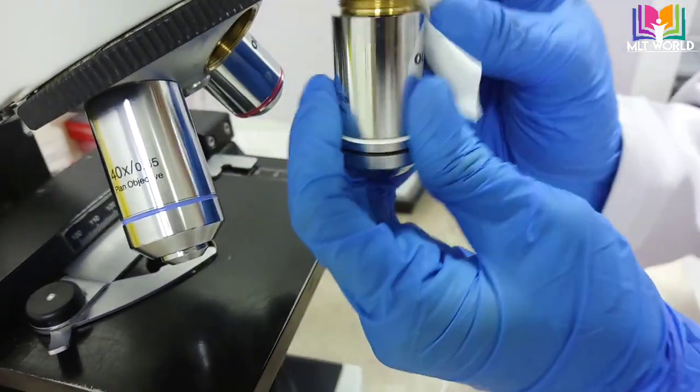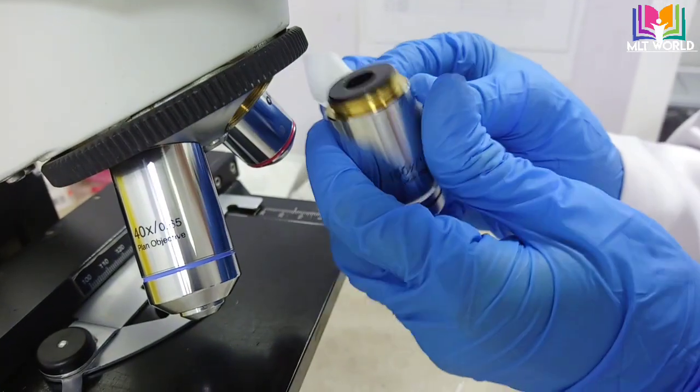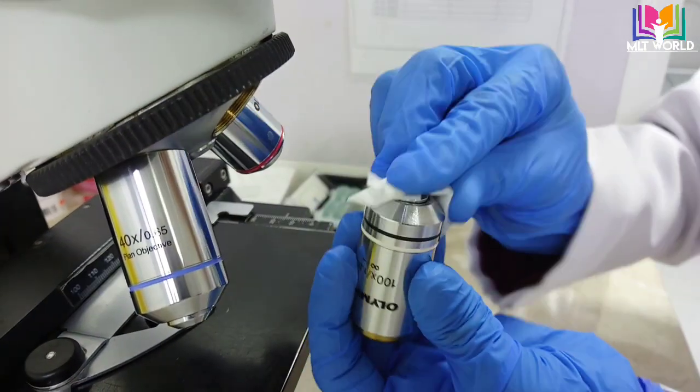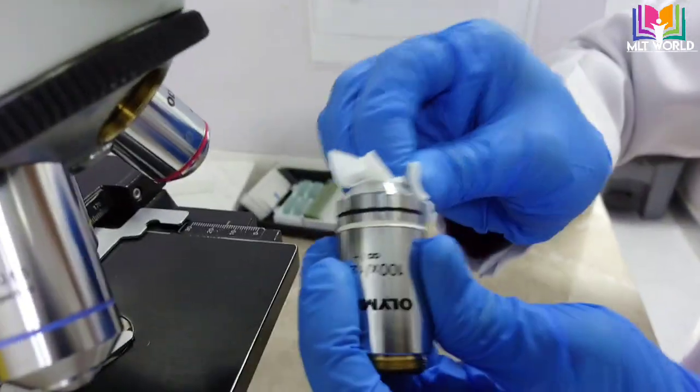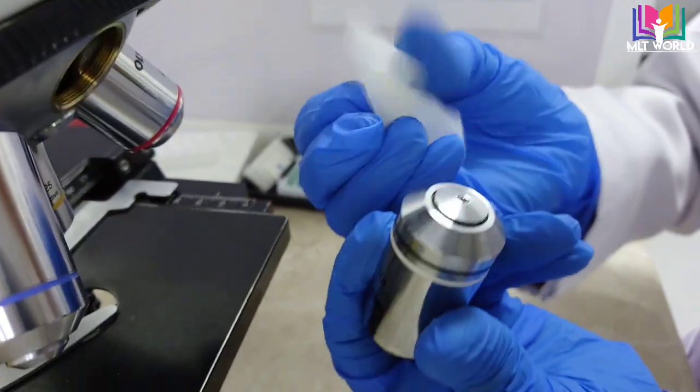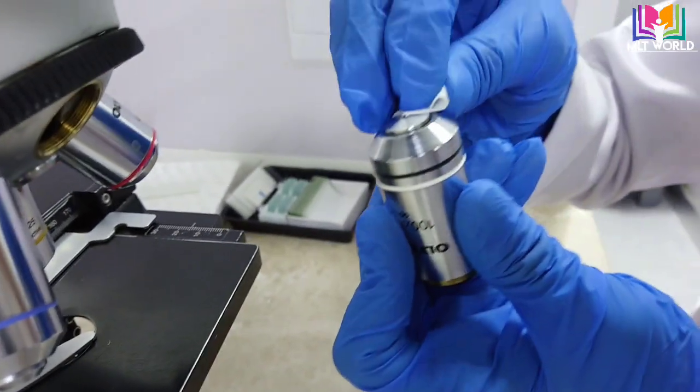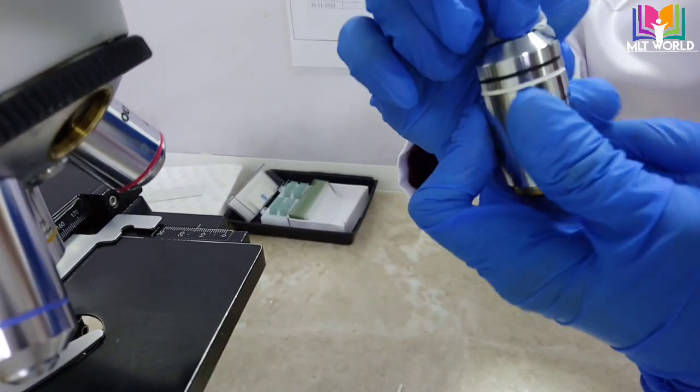Because this oil will touch the lens and the lens will become more dirty. At that time, it will be difficult to read the film. Especially if you clean this area, you will see some green color. That is dried oil.